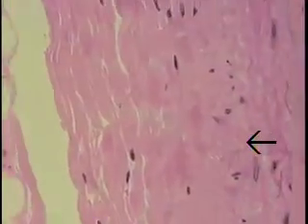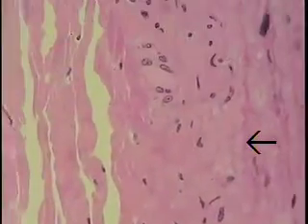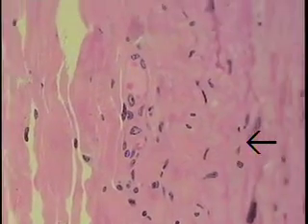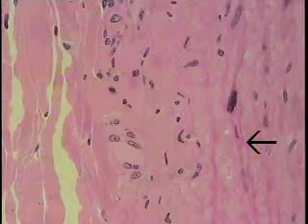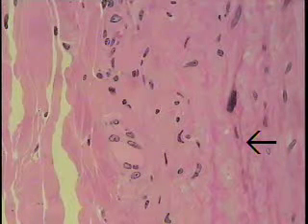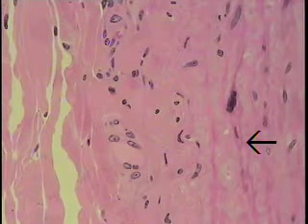Those were the examples that we found right there. We don't need to look any further. We see both a venule or a vein and a small artery or an arteriole. So these are the vasa vasorum, and numerous examples of these can be found if one examines the tunica adventitia.